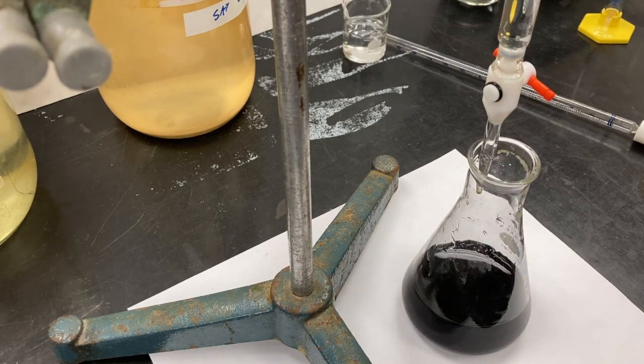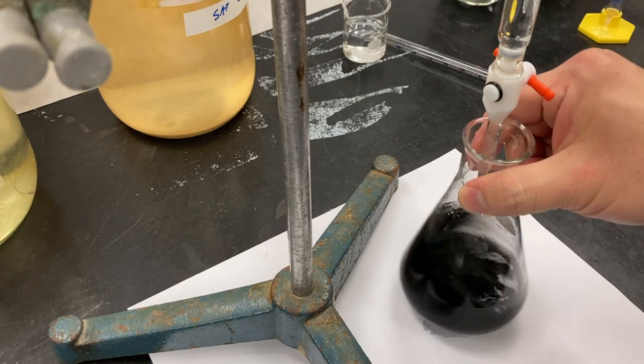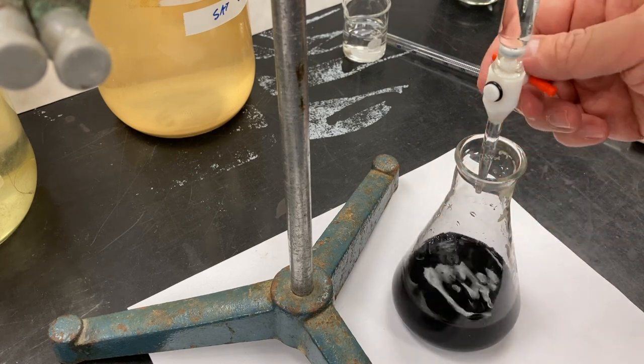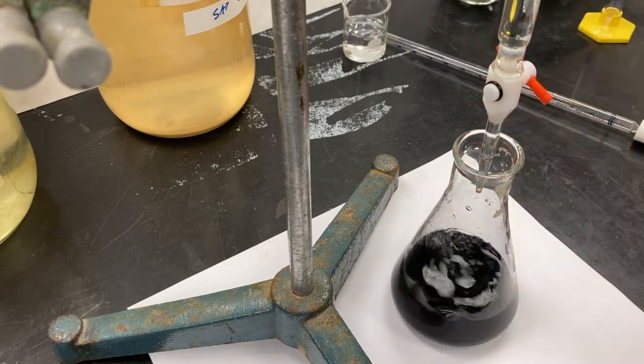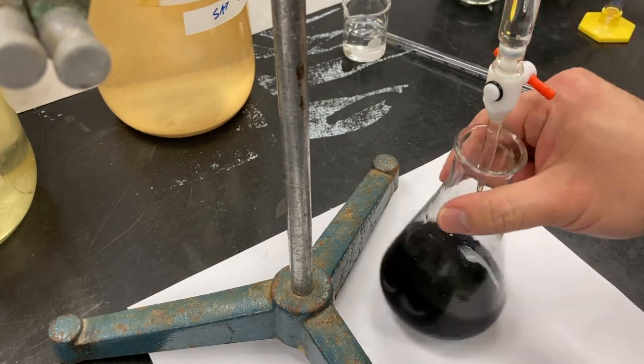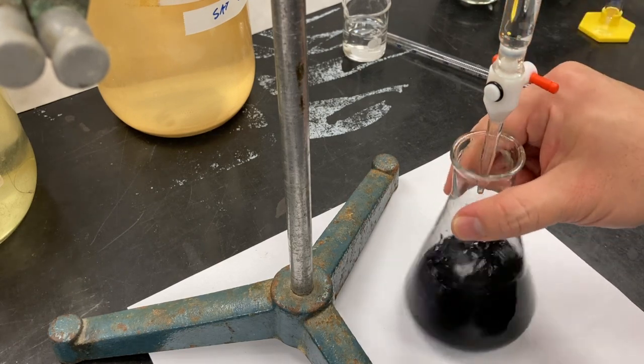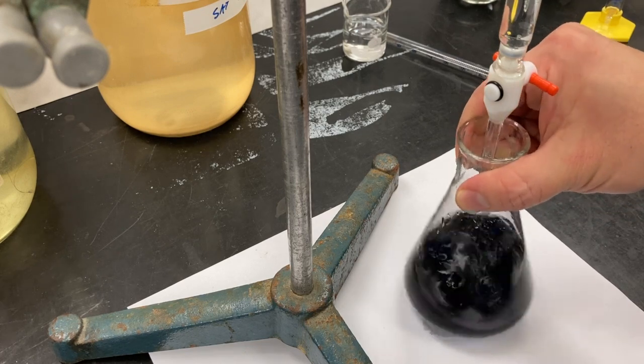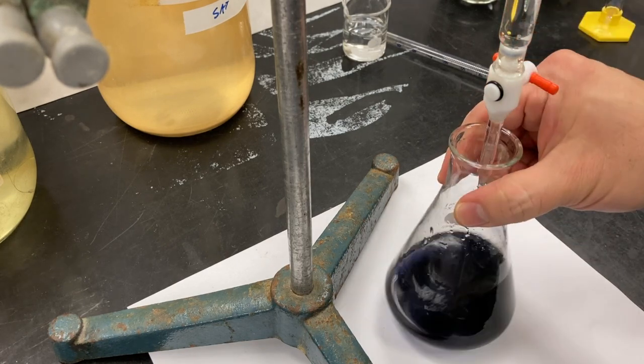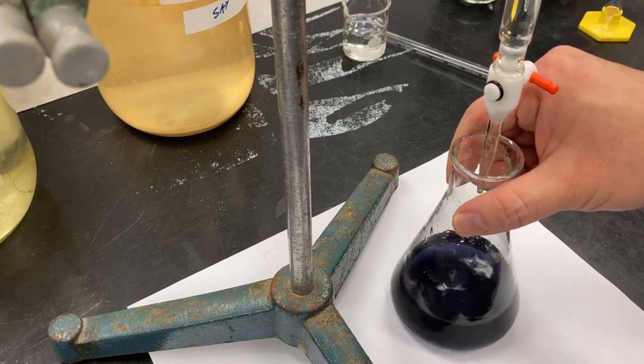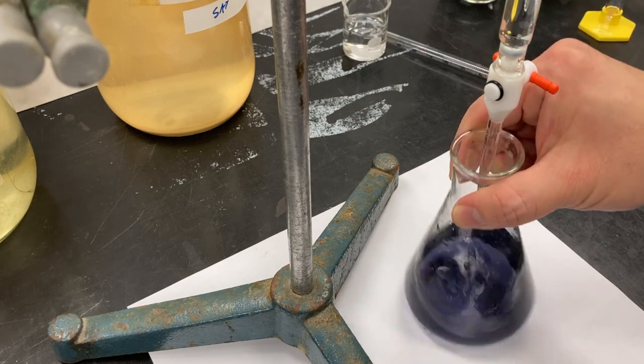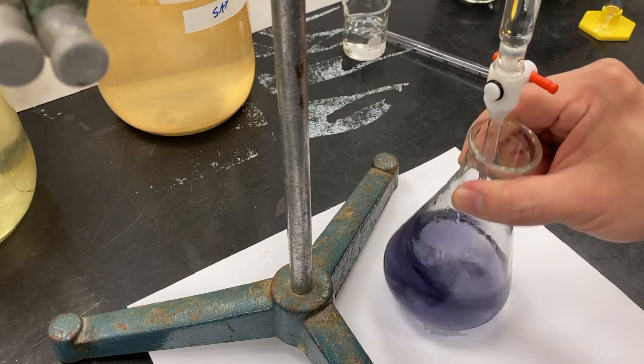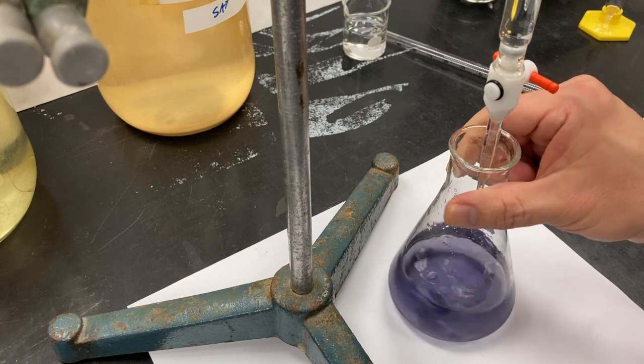Let's rinse the side walls a little bit. Probably adding about 0.2 to 0.3 milliliter increments. As soon as I see lightening I'm going to slow down and decrease the increment size. I think it's starting to lighten a little bit. Oh, yep, definitely is lighting up. Probably just a couple drops to do it.